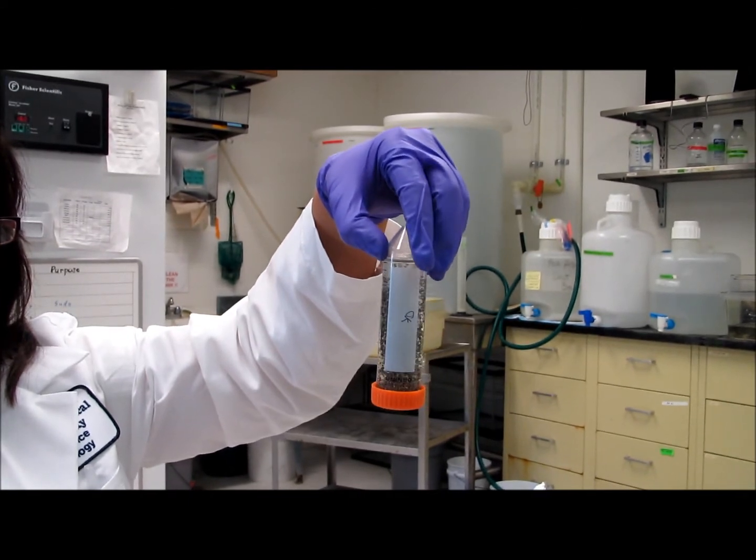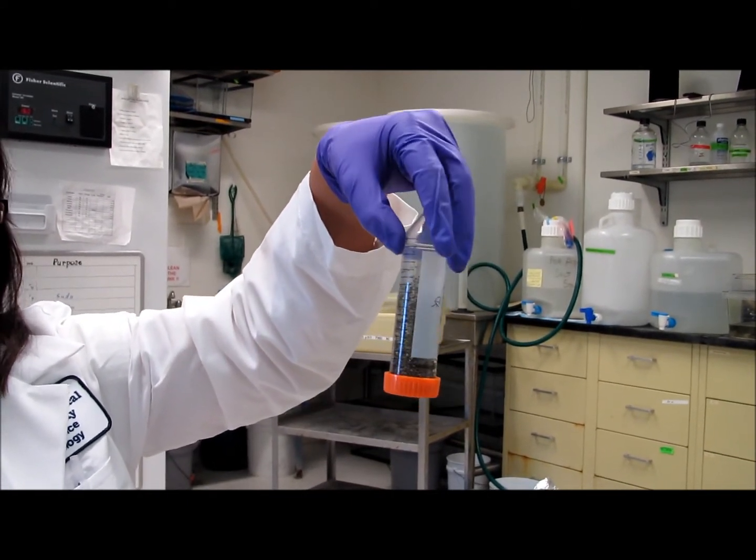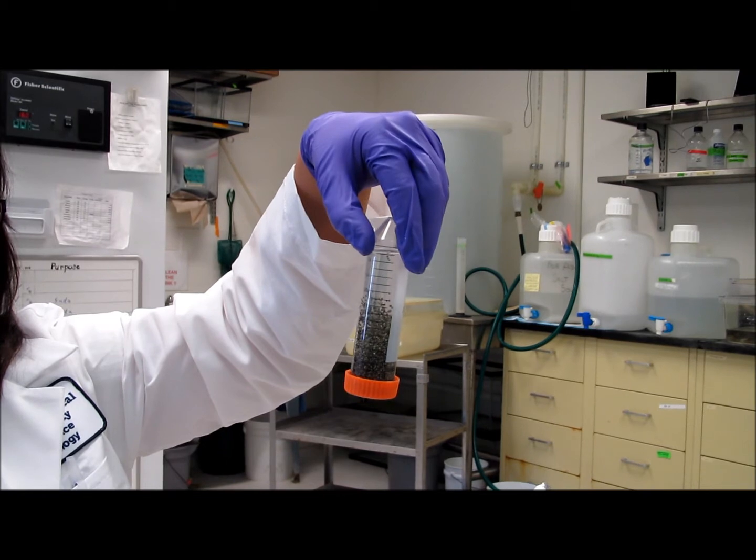So they are going to be more compact? Yes. So how long does it take? About 5 minutes.